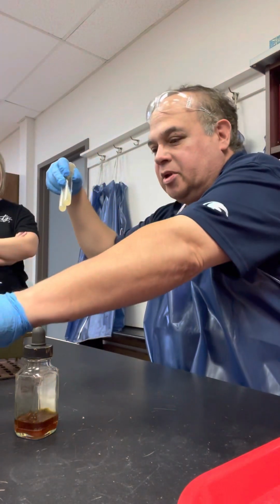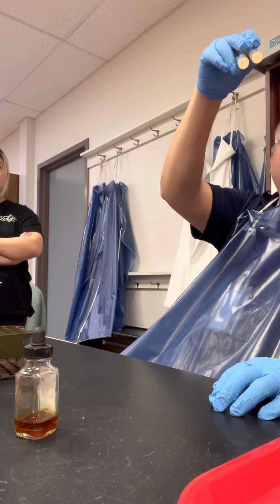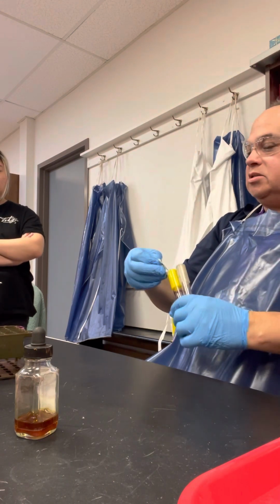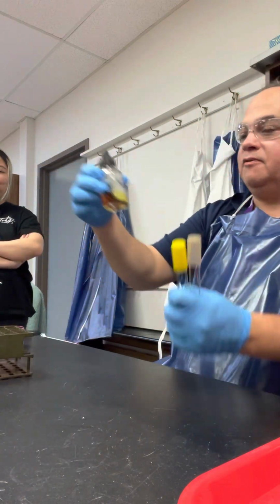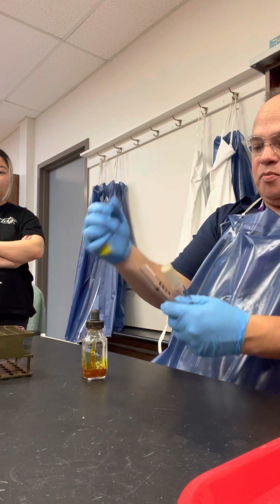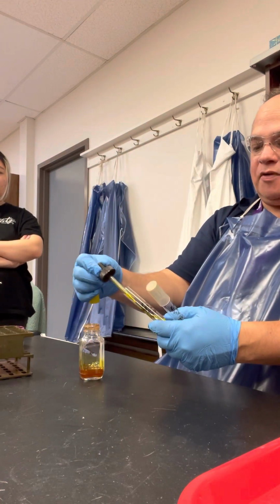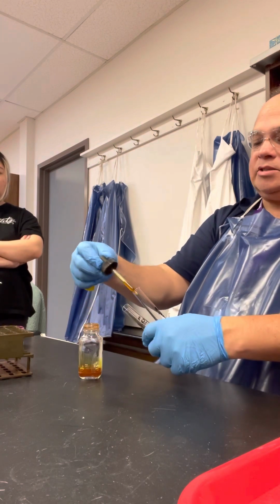So here's a deaminase test. How did you inoculate it? SSSB. So when we SSSB it, all I'm going to do is add a little bit of ferric chloride to it, about 5 drops. You pull it a little bit, but about 5. You didn't count them individually. Yes, I did.